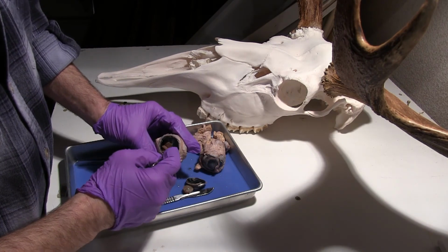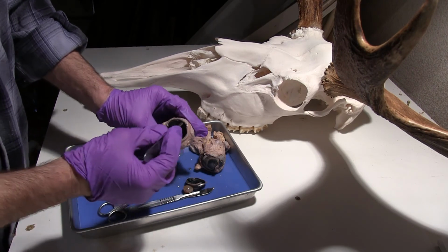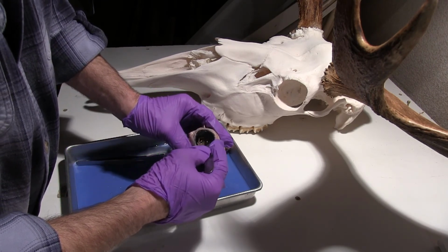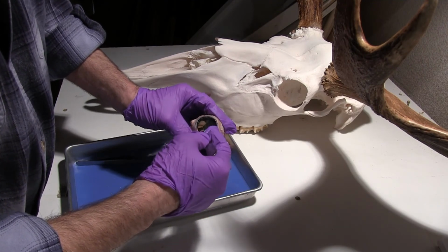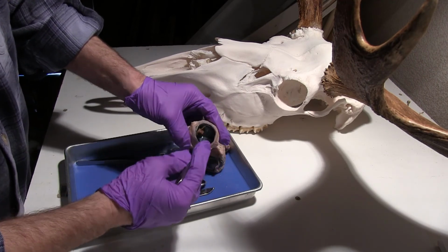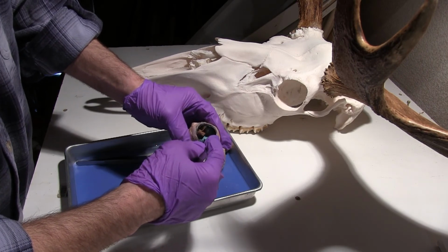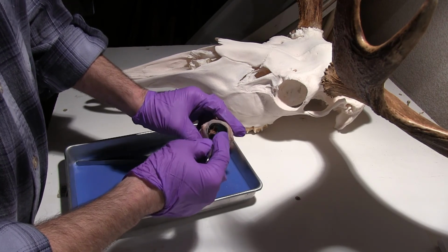Okay, so when I push this membrane out of the way, that's actually part of the retina. So that is going to be this delicate white membrane right there. This, going back from there, we actually have, specific to a cow's eye, or actually ungulate eyes, so any hooved animals that have to see better at night, and also some predators, we'll have what's called a tapetum lucidum.